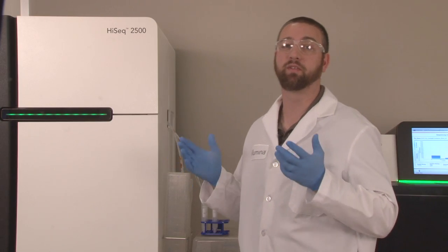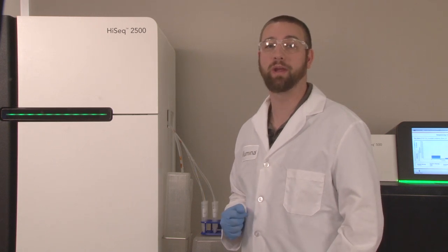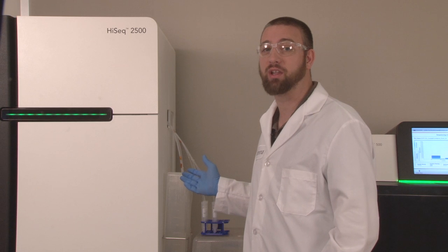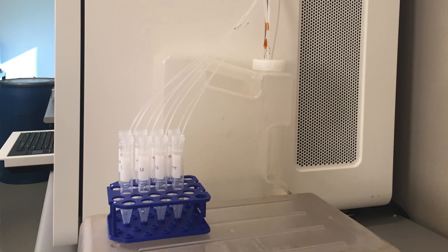Because the Hi-Seq is a fluidics based instrument, it is vital that routine water and maintenance washing is performed. When performing any wash, it's important to separate out the waste lines for accurate collection of waste volumes.